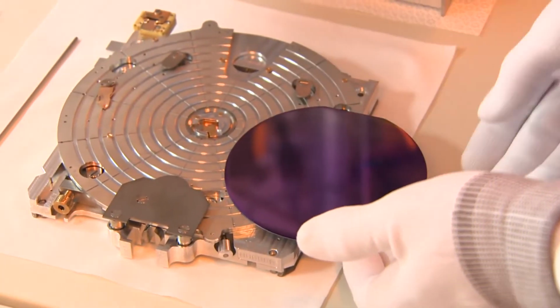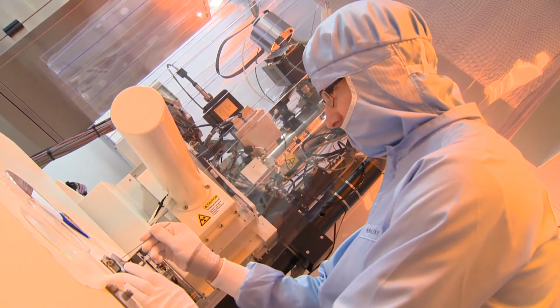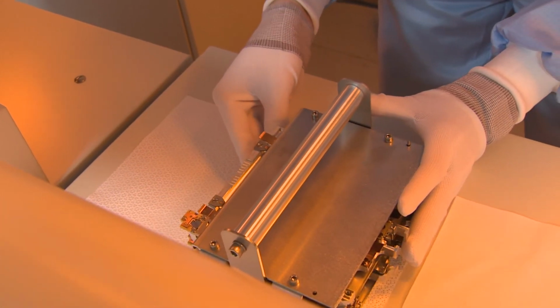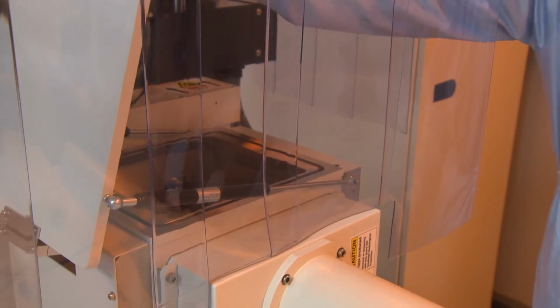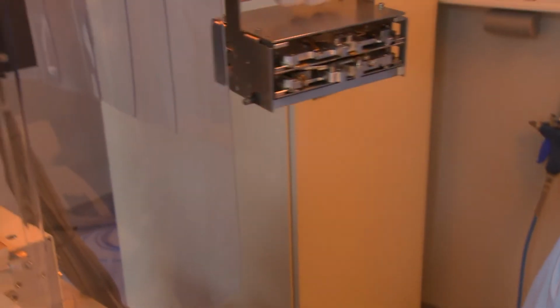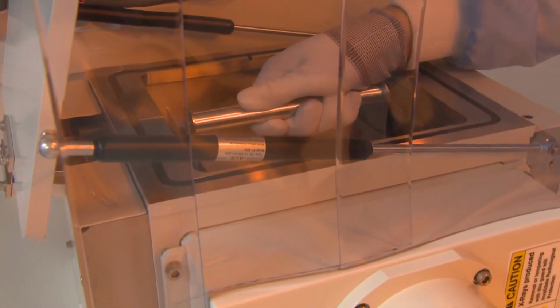Exposure takes place on thin silicon wafers in an emulsion that is sensitive to a beam of electrons, much like the old camera shutter clicking and releasing light on a celluloid film for a short time. The image is formed gradually in small boxes, and it takes a while. Our photograph will be exposed for about 4 hours.